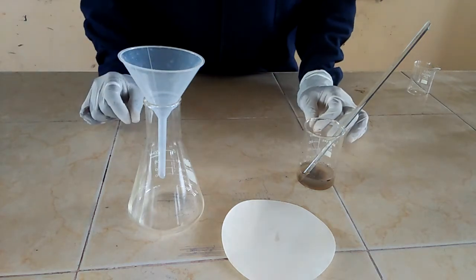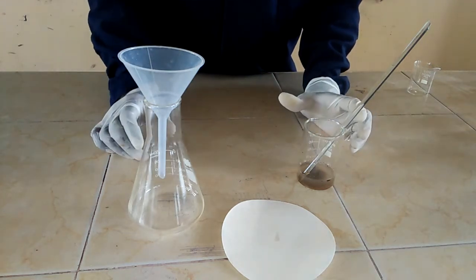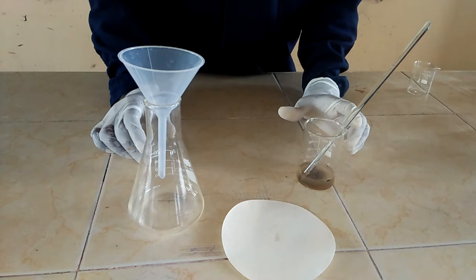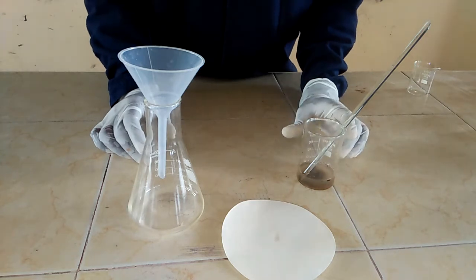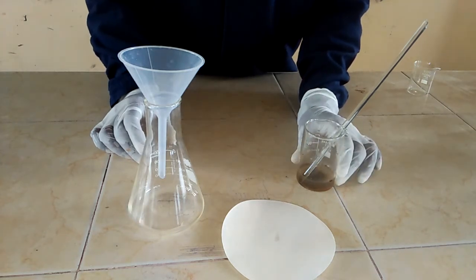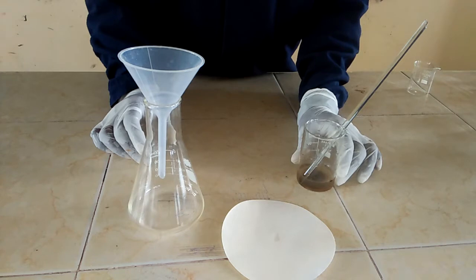How are you? I'm going to explain how to separate a mixture of insoluble solid and liquid using the filtration method.